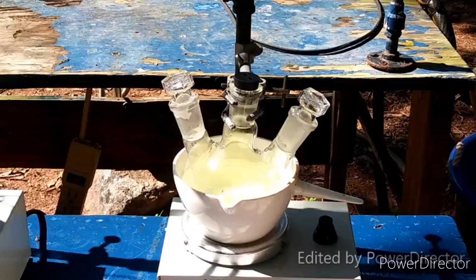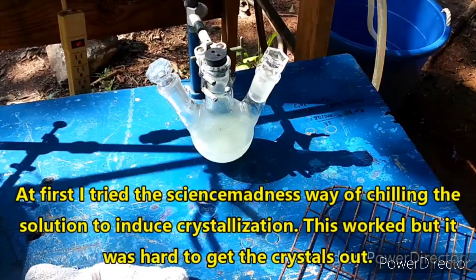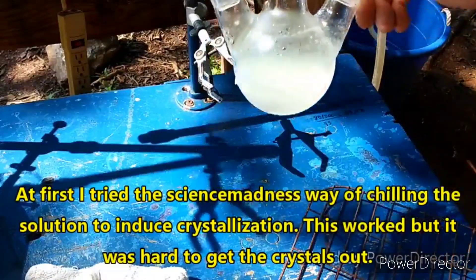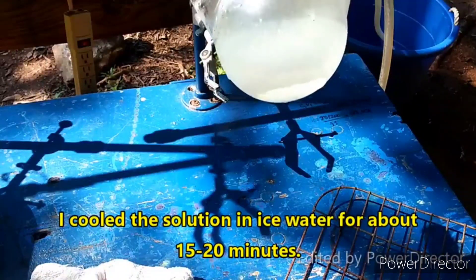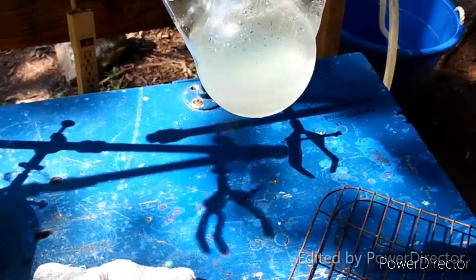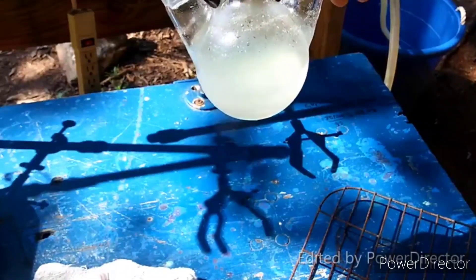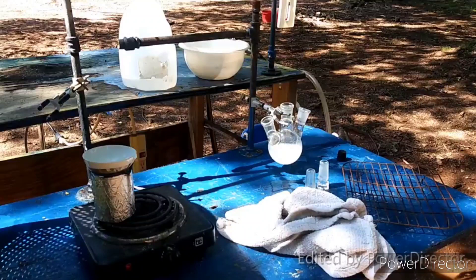I'm going to let this stir and cool down slowly. So we have a bit of a conundrum here. Trying the Science Madness way of just cooling it down to get crystals works — you can see them there, they're very pretty and sparkly. There is our compound right there. But the textbook says to evaporate this down over a steam bath until we get crystallization and then filter those off. So I'm going to try airing this thing out first and give it a shot.